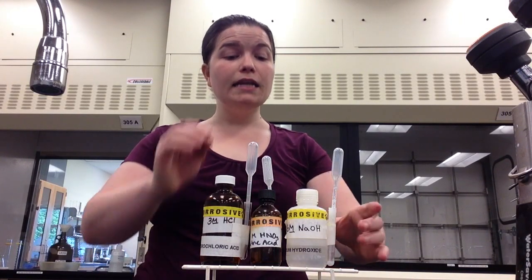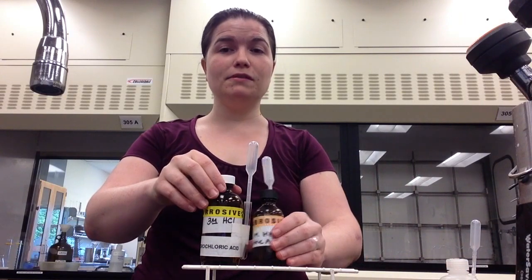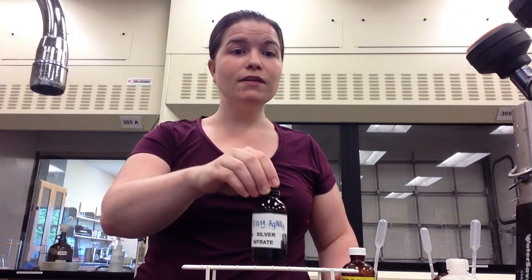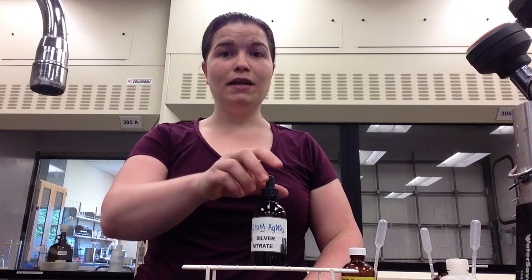In addition to the use of these three caustic chemicals, silver nitrate is a part of this lab. While silver nitrate will not damage your skin, it will stain your skin for a few days, so use care when handling silver nitrate.